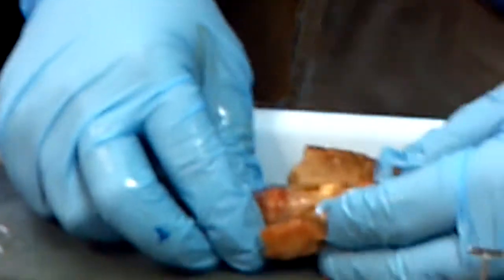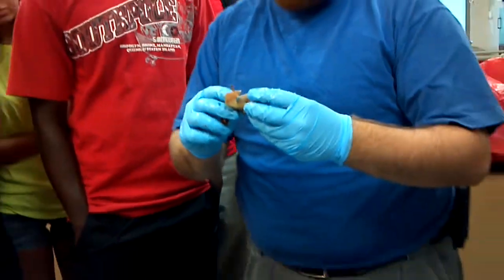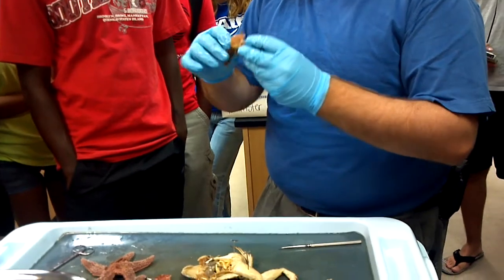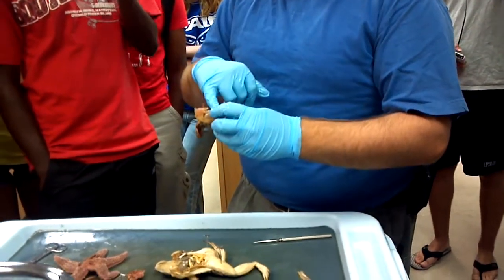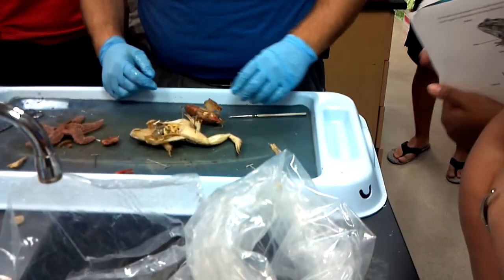If you really want me to go through the parts of the crayfish, there's only like four of them. The heart's already gone — whatever you're going to put on that exam. Gills are here. You can't even really see anything in there. You can see the gills, that's about it. The brain isn't bad if you bother to open up the skull. And then this one is one of the digestive glands.